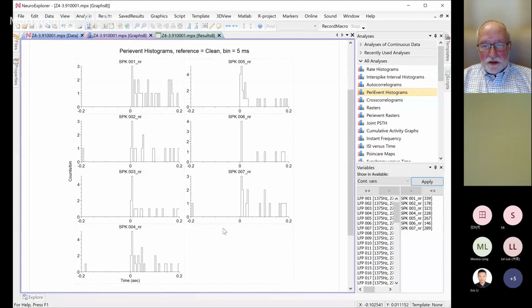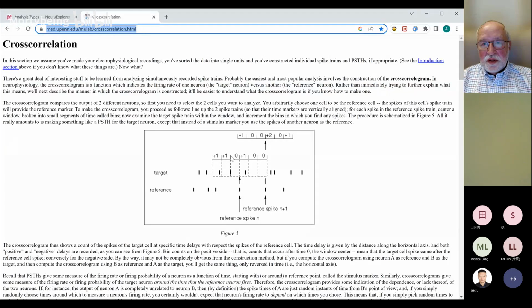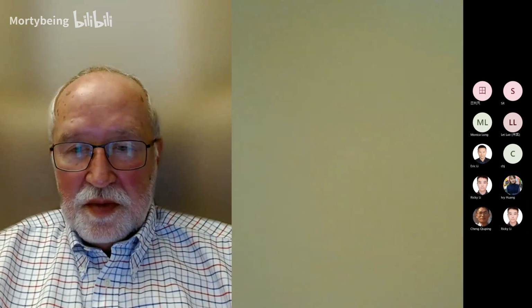Bin is the bin. Let me show this picture again. So bin is the width of this window. We look at the reference event. It could be a short bin or a long bin. We count how many spikes in another channel fall within this window. This could be narrow, so now we have 5 milliseconds. But we can set it to, for example, 10, and then it will be less detailed information, but we will count these spikes within wider bins. So we can set the duration for the bin. Yes, the bin size.